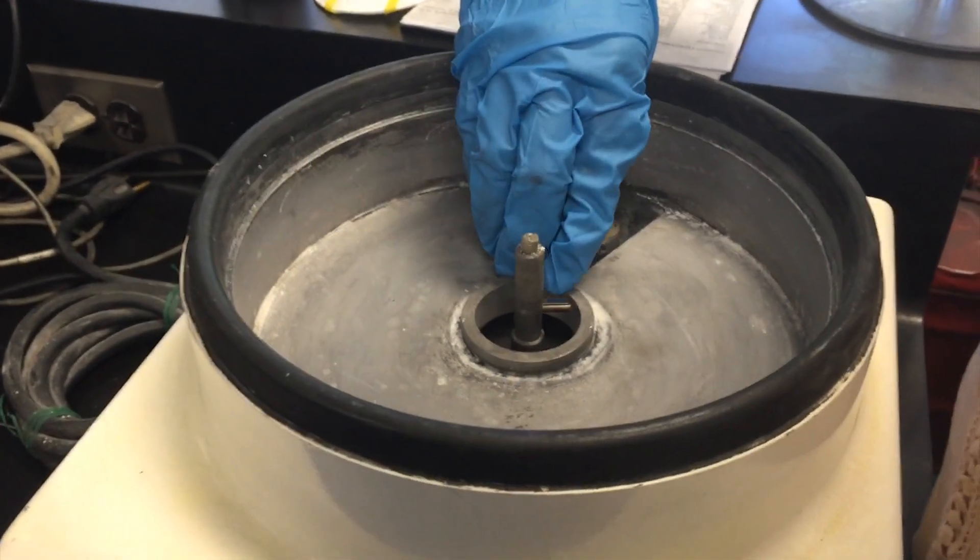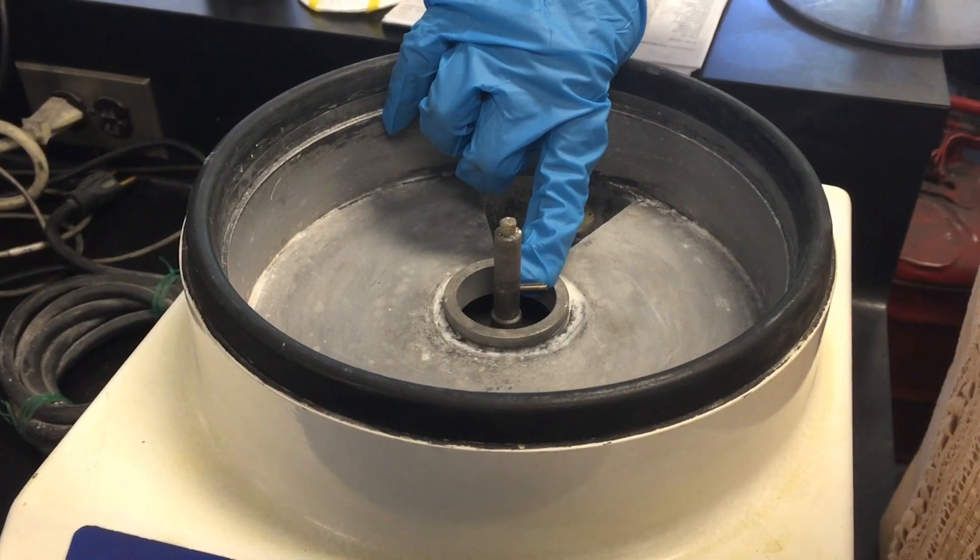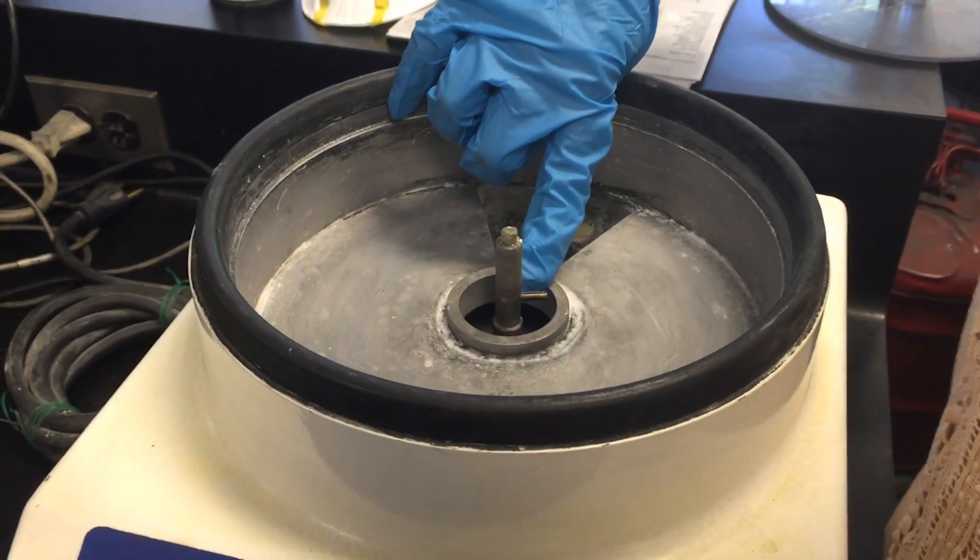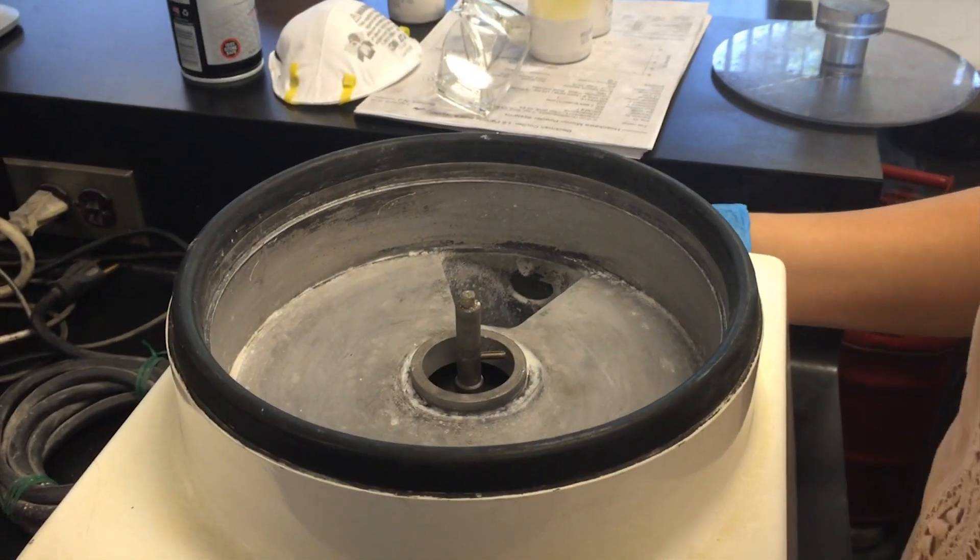As you can see here, this is what we refer to as the shear pin or the roll pin. This pin is what helps the wand rotate so that it disperses the material evenly across the sieve screen.